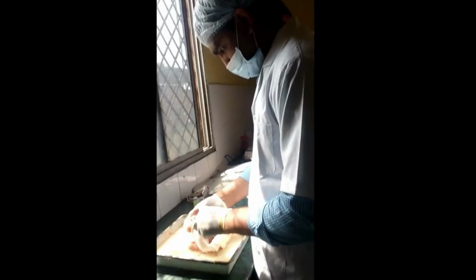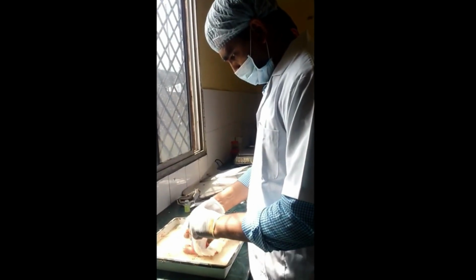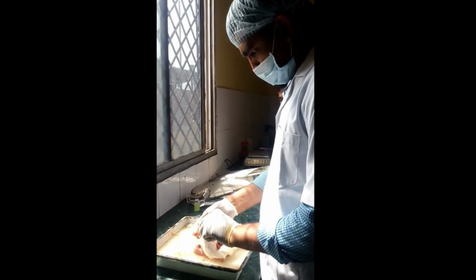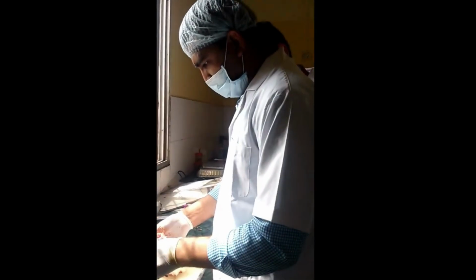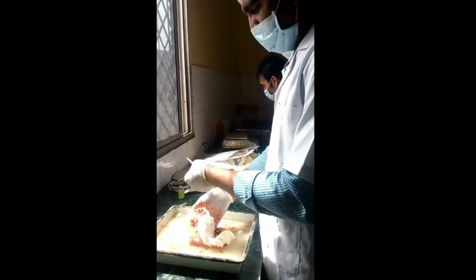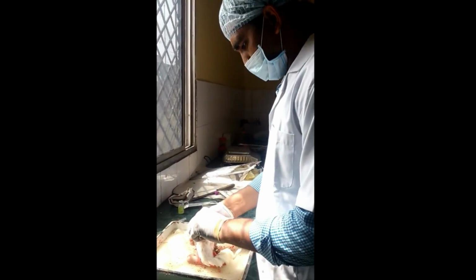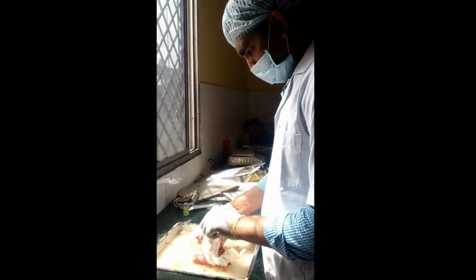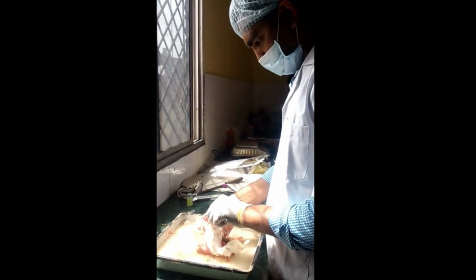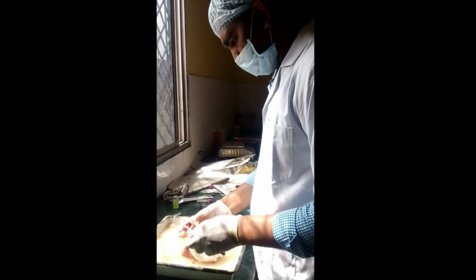Continue removing organs one by one: stomach, intestine, pancreas, lungs and heart. Ensure each organ is handled gently to avoid damage. Immediately place removed organs into a labeled histopathological tube containing fixative. Preserve the tissue for further analysis.